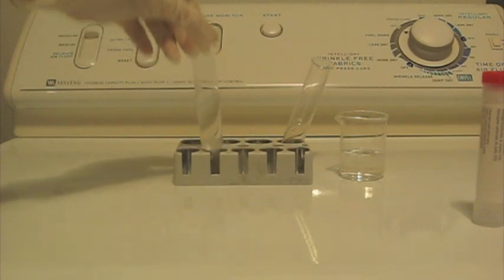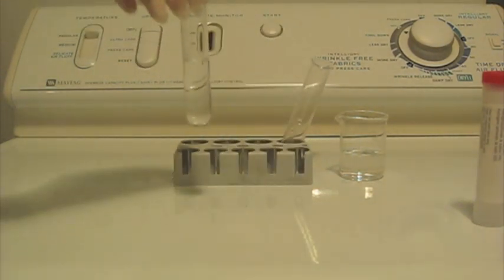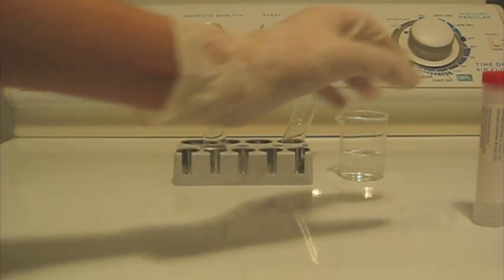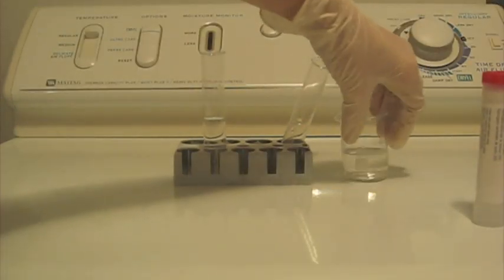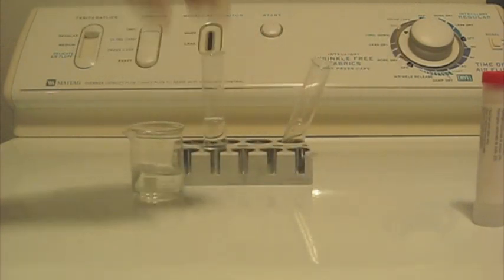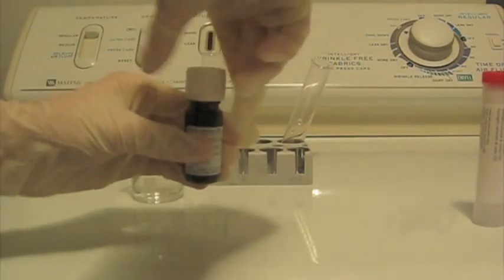I've moved everything inside. This is my hydrochloric acid, which I made. I've tested it with some things like zinc powder and even sodium hydrogen carbonate, and it hasn't seemed to get a reaction out of them where zinc powder would form hydrogen and sodium hydrogen carbonate would form carbon dioxide.